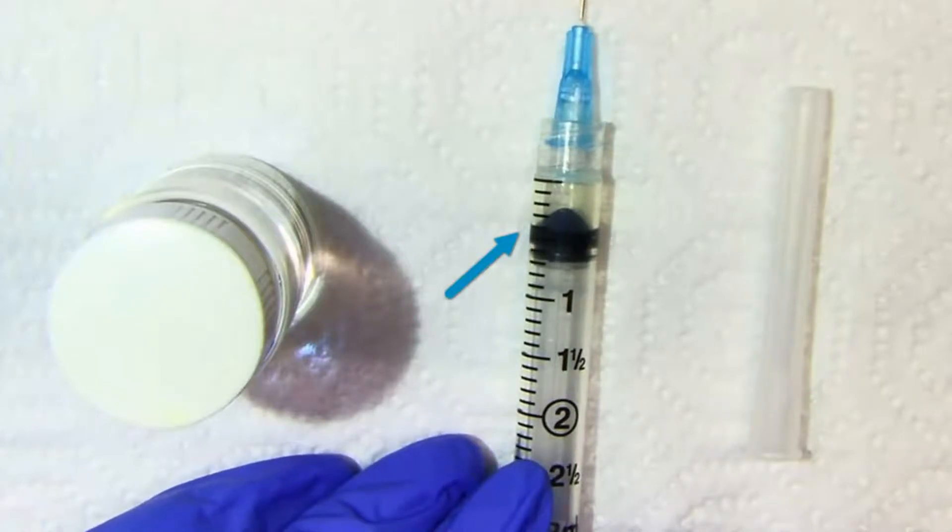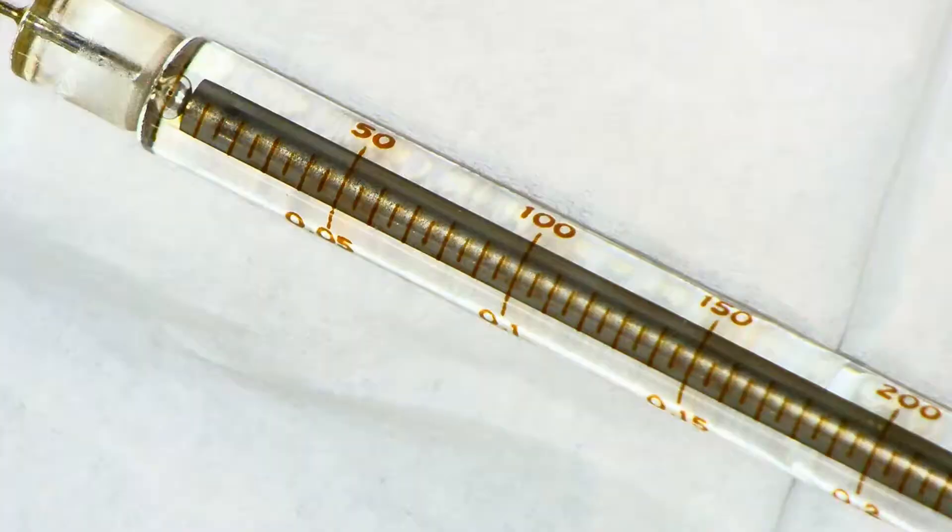One, two, three, four. This is the syringe we use to obtain 78 or 76 microliters of our desired ester. You can see that you are going to have to read between the lines. Can you see where 78 is on this?